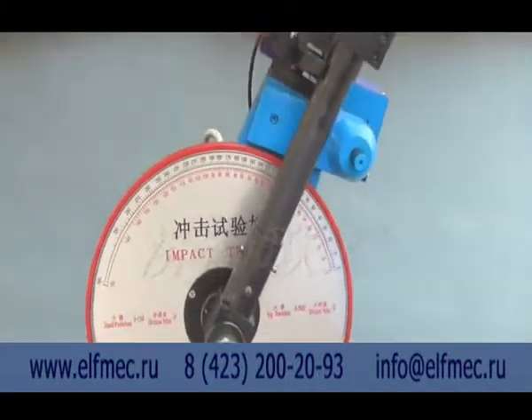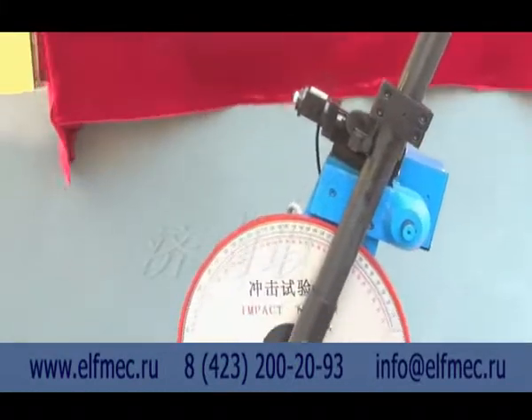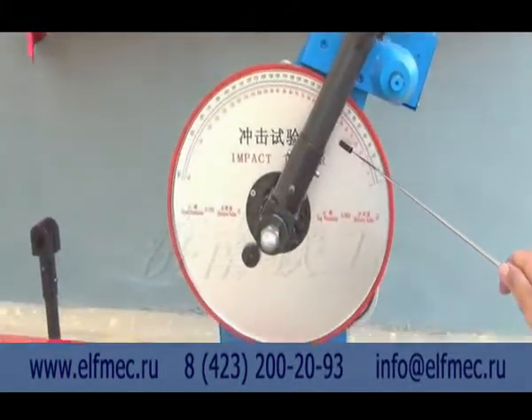When operating with the computer, please read the microcomputer control software instruction book carefully.